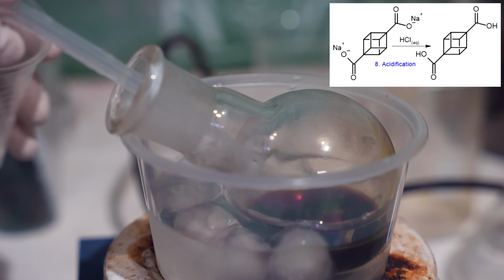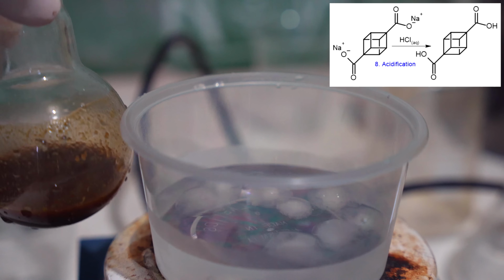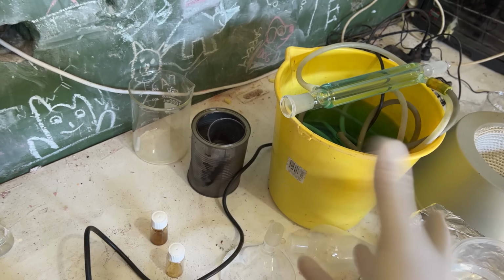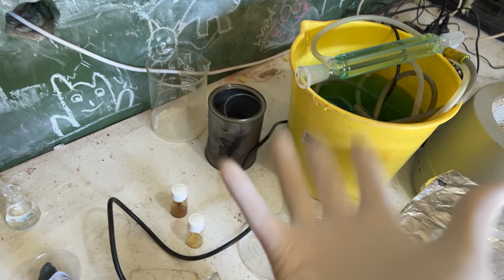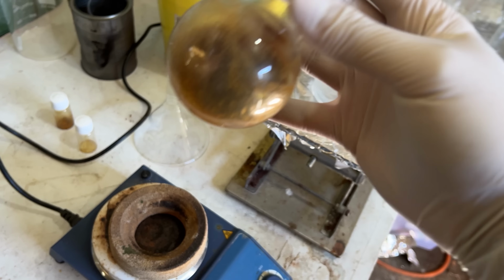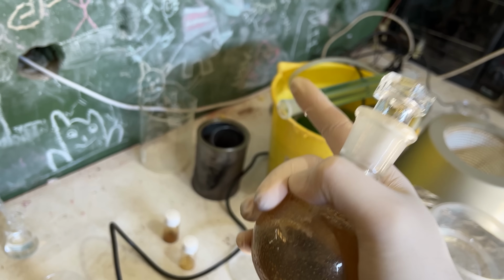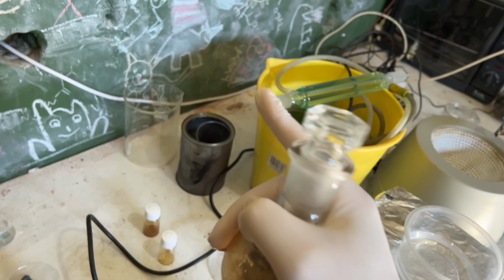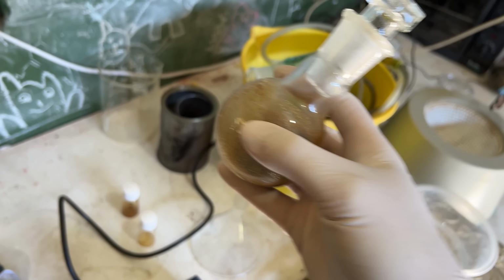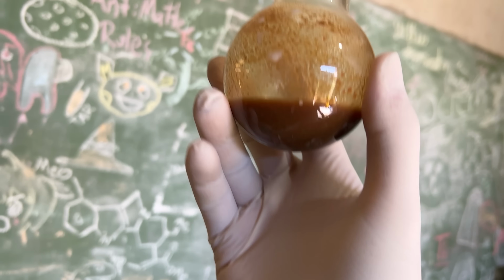Now, the bit that tricked us up last time was that none of the Cubane dicarboxylic acid precipitated out. It was just the benzophenone, which is what led us astray. However, when we added the acid this time, we see a lot more precipitate, and that's this thing here. Look how much precipitate is in here. So, I could be fooled again, and I don't mind being fooled by chemistry, because chemistry is a crafty trickster, but getting fooled twice by the chemistry is not something I aim to do. I don't want to get fooled again by this, but there does look like a huge amount of precipitate in here.